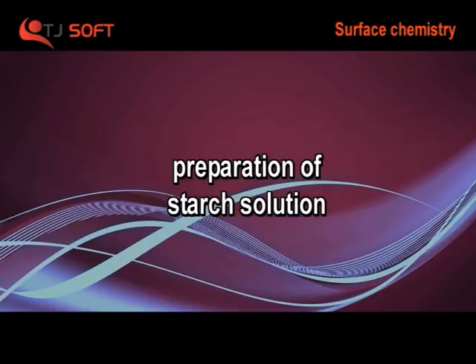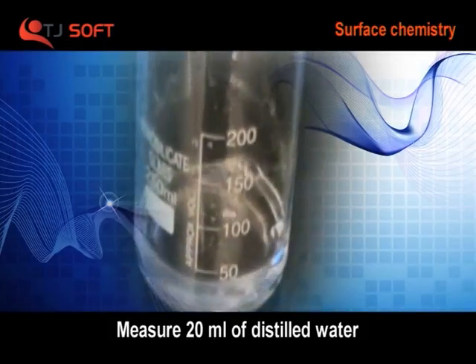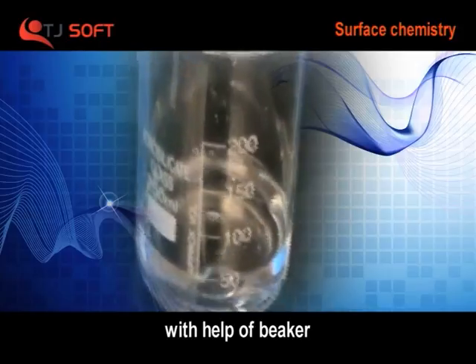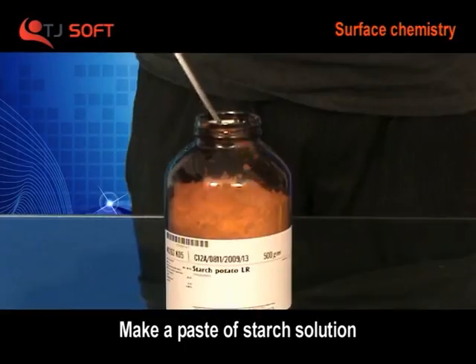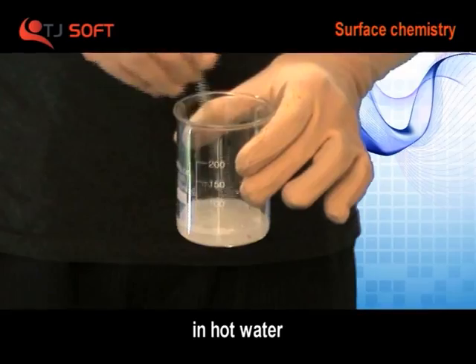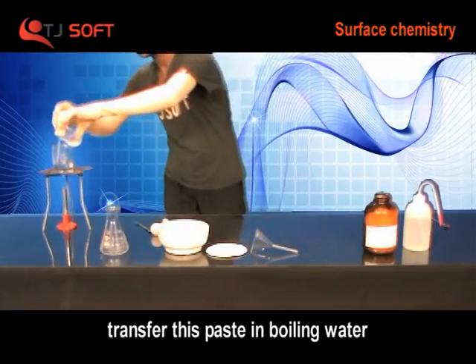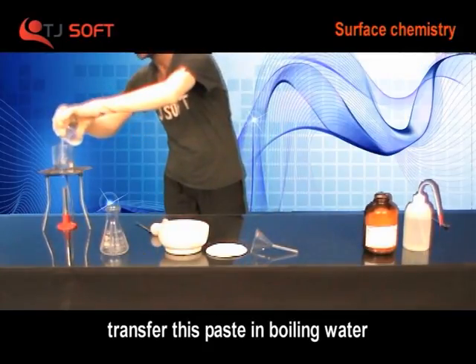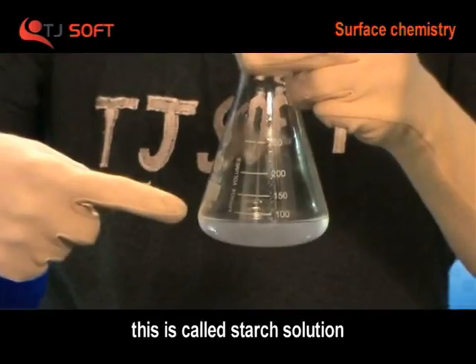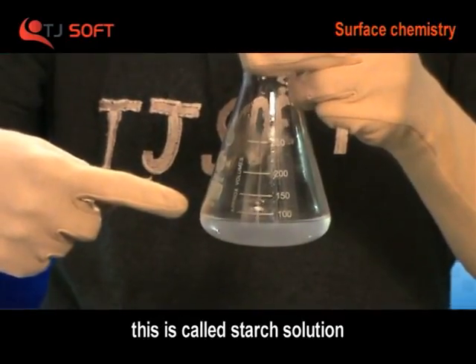Preparation of starch solution: Measure 20 ml of distilled water with the help of a beaker and boil it. Make a paste of starch in hot water. Transfer this paste into boiling water with constant stirring. The solution formed is called starch solution.